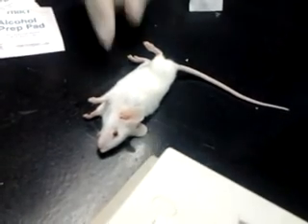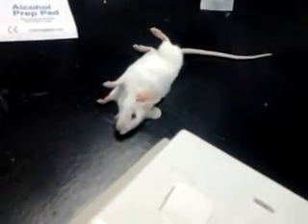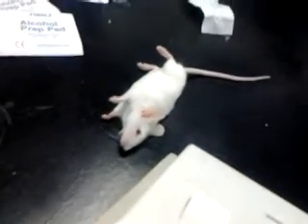Still breathing? When you pinch the toenail, you see they feel the pain, even though I give 0.1 ml per 50 gram. I'm going to use the same dosage to give IV. You see how fast you sleep.